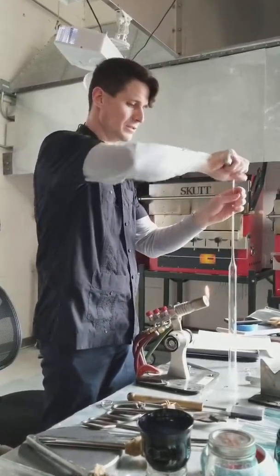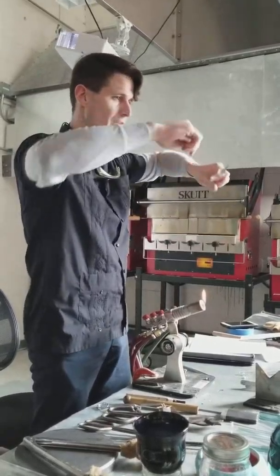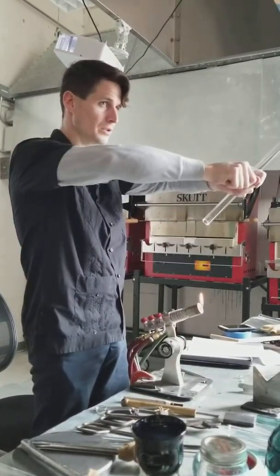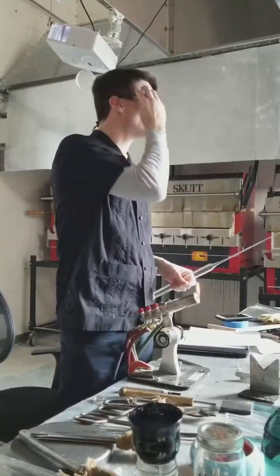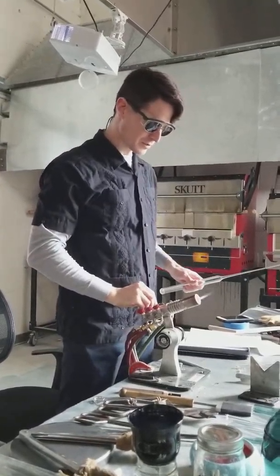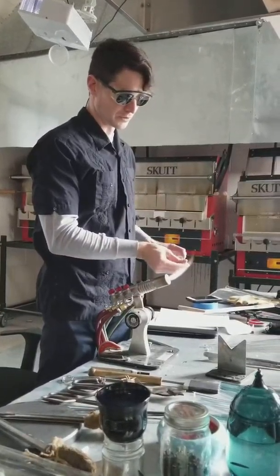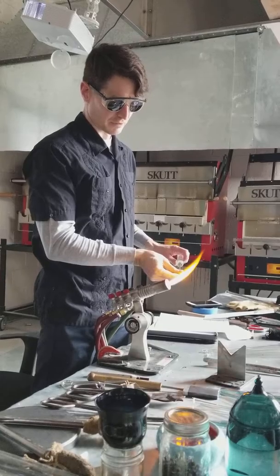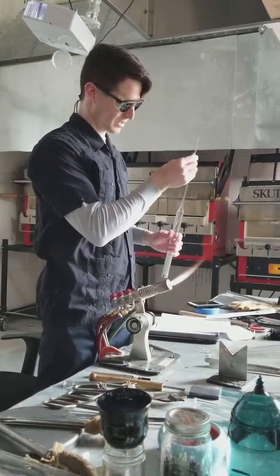If you go heavy on the score you can have a nice cut surprise. Break into the weak side of the point — the score line should be away from you. Push with your thumb on either side of it. Then fire polish that end so you don't cut your mouth when you're using it to blow. Notice I'm in a really soft reducing flame here so I don't close that hole off — I'm just rounding off my edges.